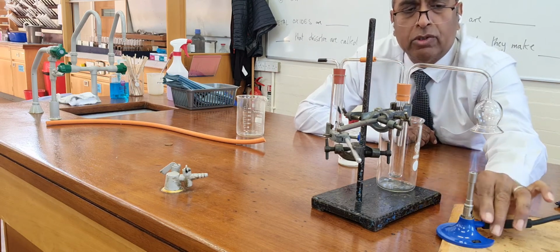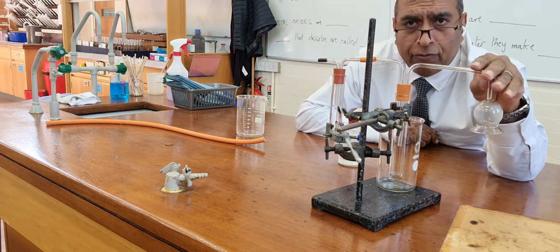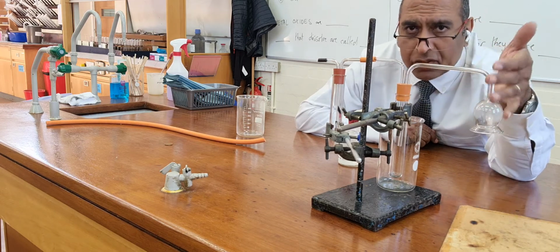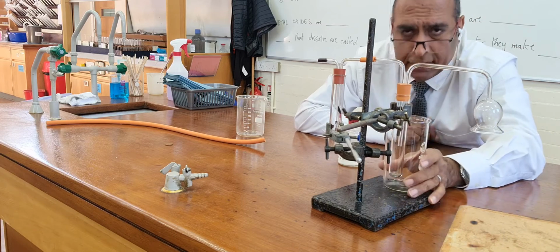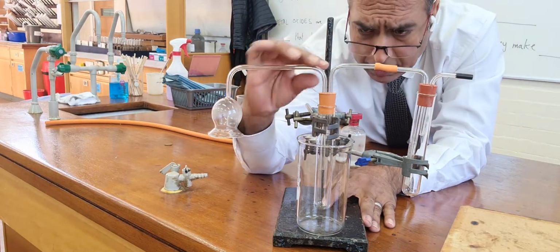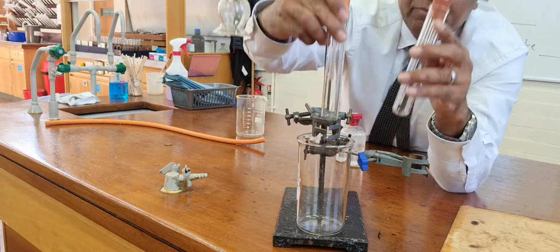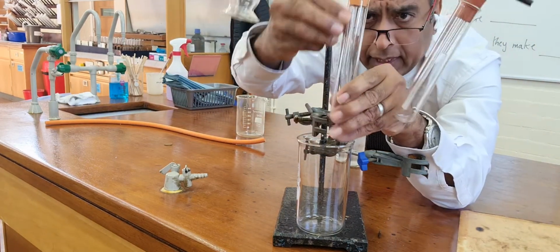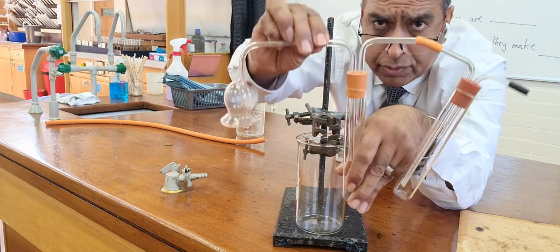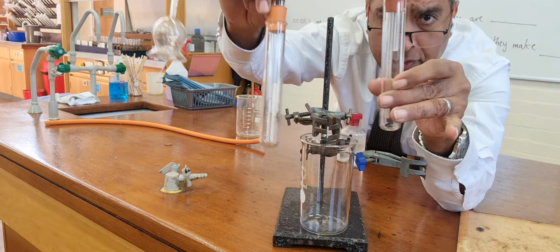Now to prove there's only water and carbon dioxide coming off it, I can put it in this funnel. It's a special funnel called a Thistle Funnel, and we've made the apparatus up ourselves. The Thistle Funnel leads into this boiling tube. The boiling tube has in it a longer stem coming from this delivery tube. The delivery tube leads to a longer stem, then there's a shorter stem coming out, and then another tube here.